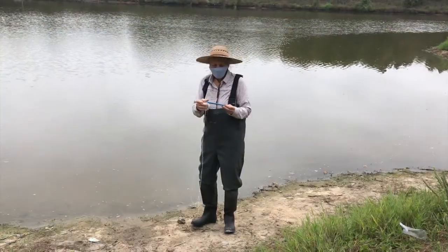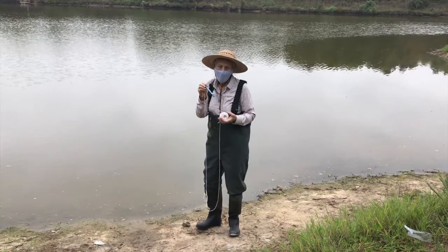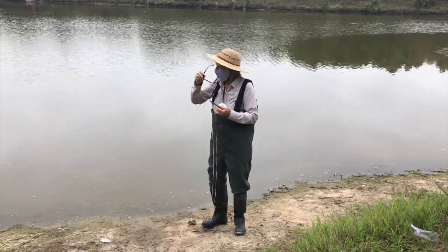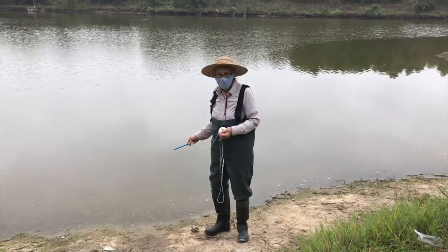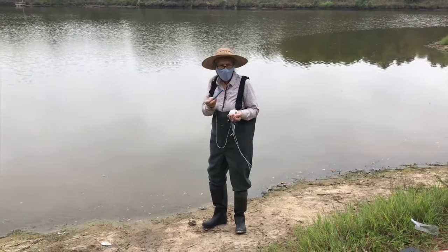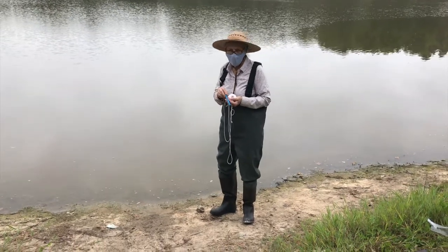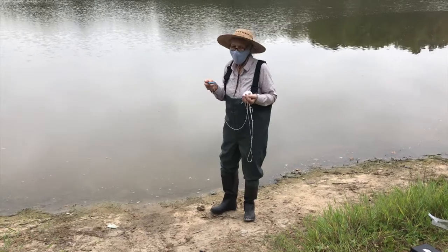We're here at the beautiful lake, and my name's Nash, and I'm going to be taking some temperature readings of the water. So the air temperature that we just took was 24 centigrade, and we're going to be taking first a couple different measurements, close in and far out. Now we talked about dissolved oxygen, so the water temperature will also vary depending on the depth of the water. And it's important because lots of different organisms can't survive if it gets too hot.